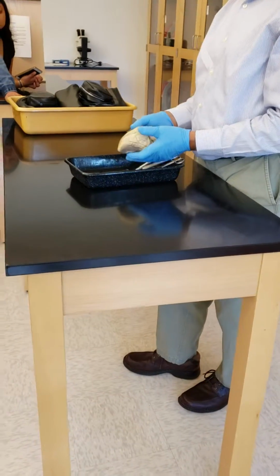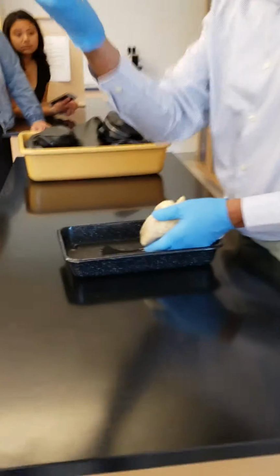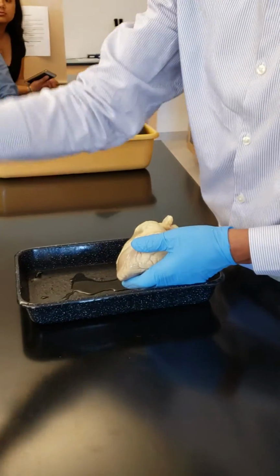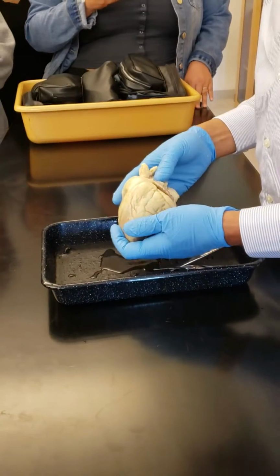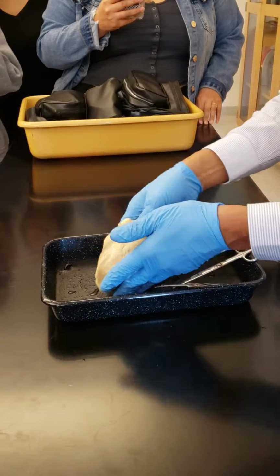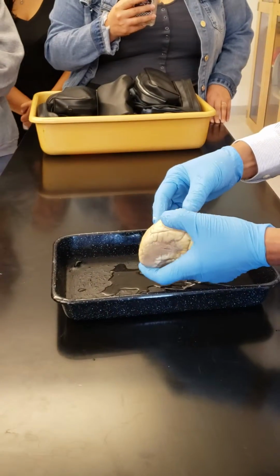From inside. In the exam, you will not be dissecting. Come closer, you'll be too far. Come here. You will not be actually dissecting, but I can ask you structures just like this from outside, but I can open up and see structure from inside.